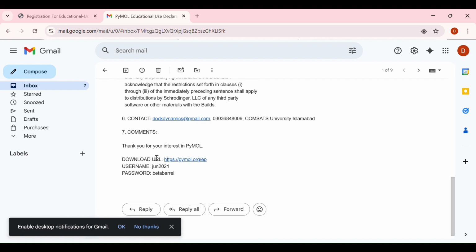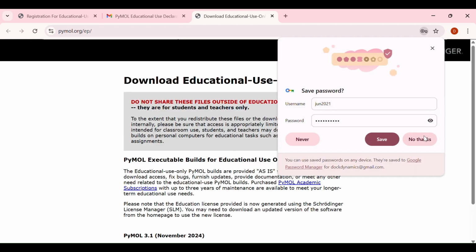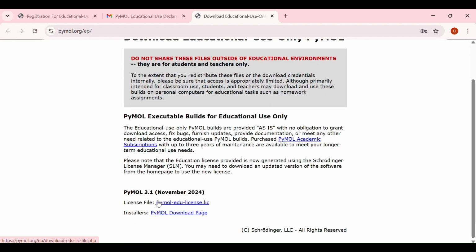Here you can see that this here is the download URL, and for downloading the license file, you have to enter the username and the password. Okay. Enter the username and the password and just click on the sign in button. And from here you can download this license file.